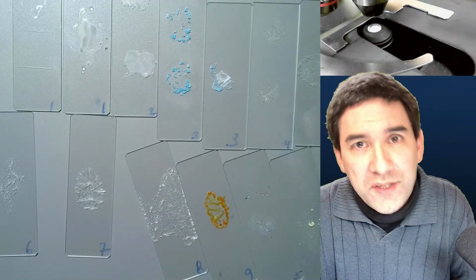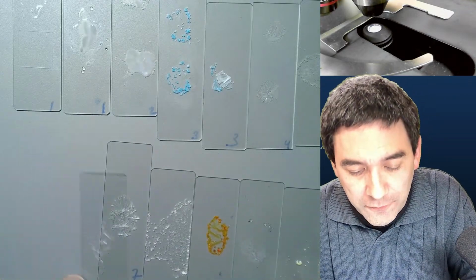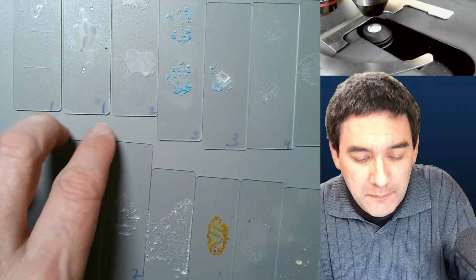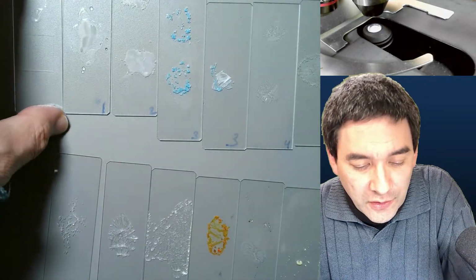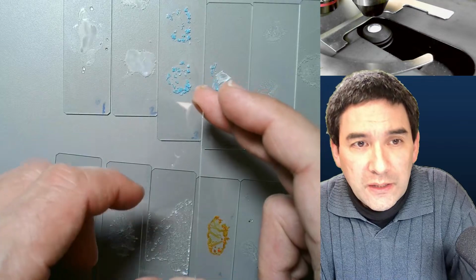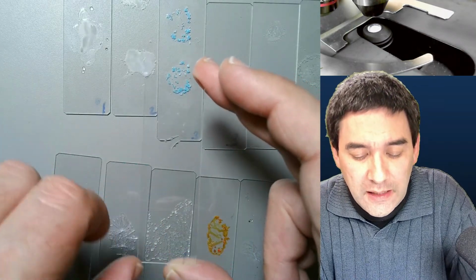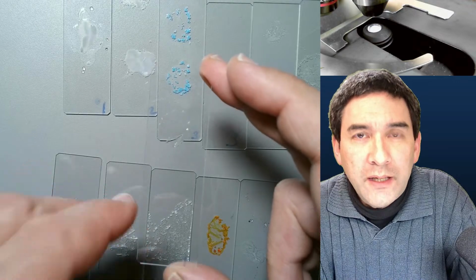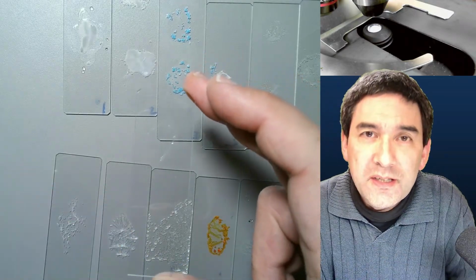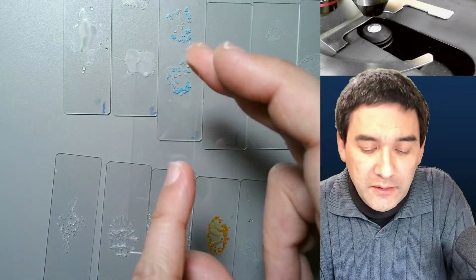This is not always easy, okay? And I would like to simply talk about some of the problems that there might be. So for example, look at this one over here. This one that I made in the morning today, so over 12 hours ago. You see that there's still a drop here which is wet. It did not completely dry, and the reason is that some substances attract water so much from the air that they don't dry properly.